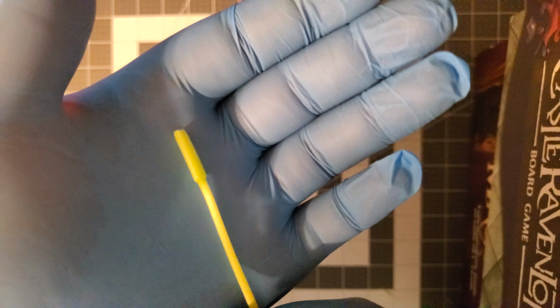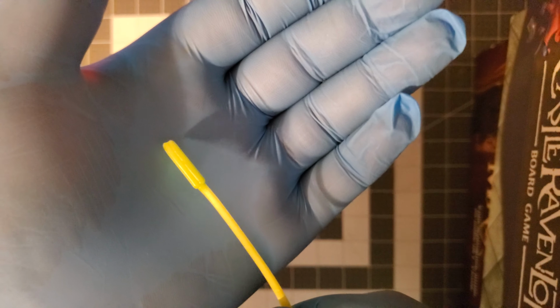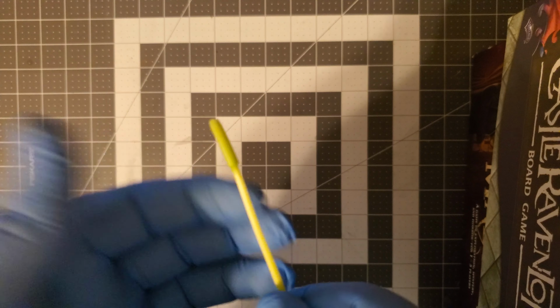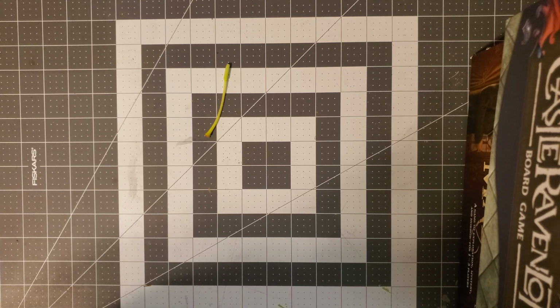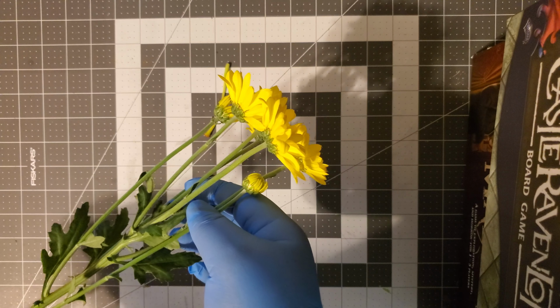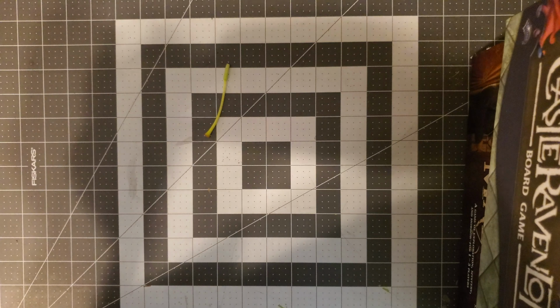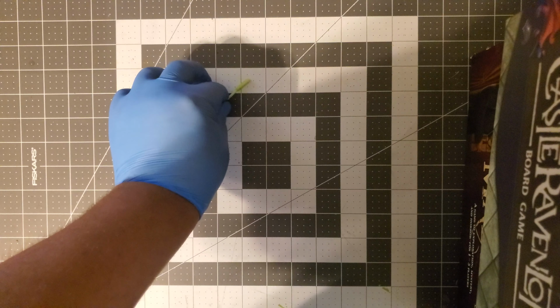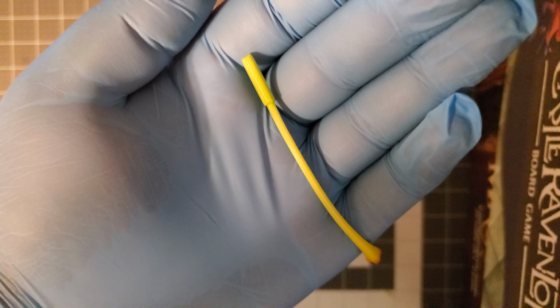So yeah, it's really cool dissecting the flowers and seeing the parts. It's pretty interesting. I had other flowers too, like the ones you told us not to get, sunflowers and yellow roses, but I found the two that I used in this demonstration to definitely be the closest to the model that you had shown.